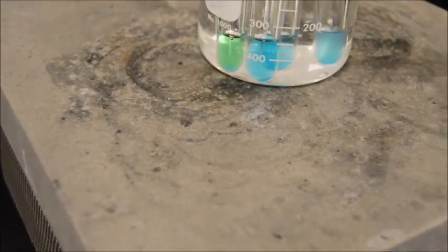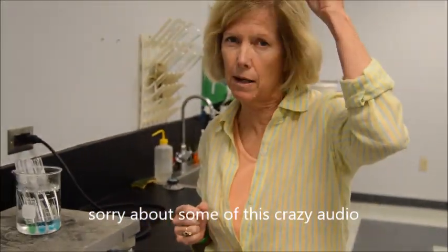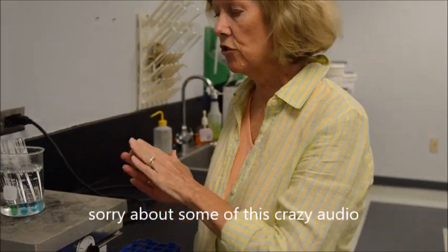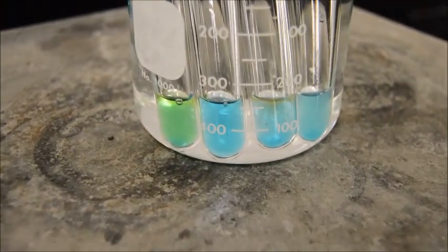So notice that the color, we're noting the color now, but the most important color is going to be the color after they are heated. This just kind of gives you an idea so you can see if there's a change and if it's enough to be a positive color. So what we're doing now is we're waiting for 5 minutes. So we're going to note the time, and then we're going to come back to these.